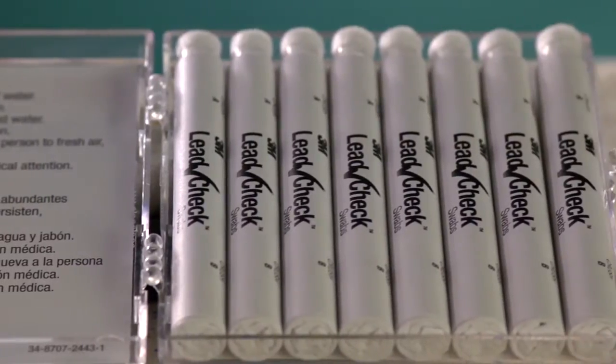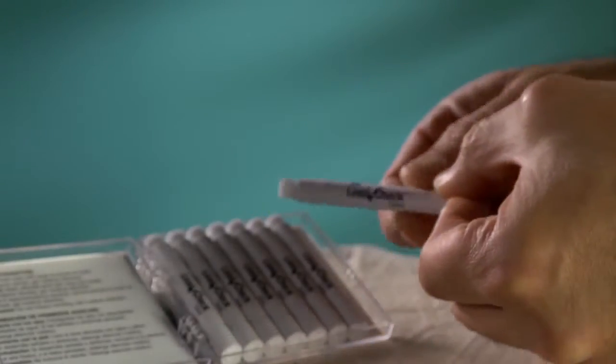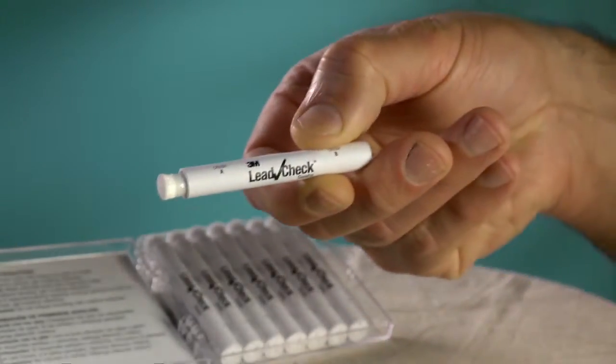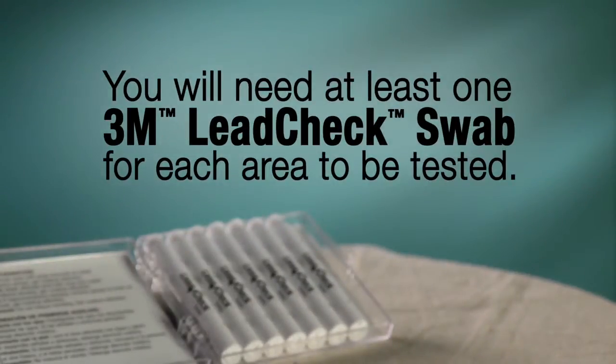For this test, you will need one or more 3M LeadCheck swabs. 3M LeadCheck swabs can detect lead at the level of 600 parts per million. Note, you will need a separate 3M LeadCheck swab for each area to be directly tested.